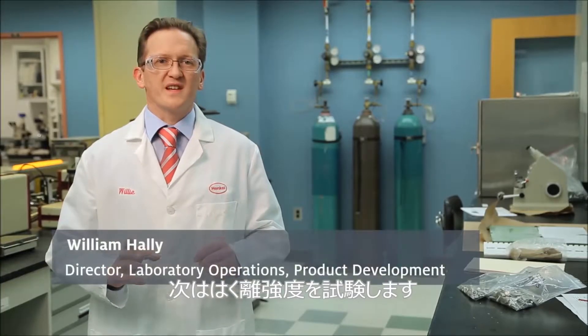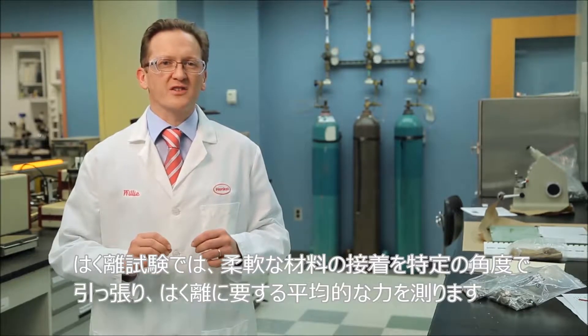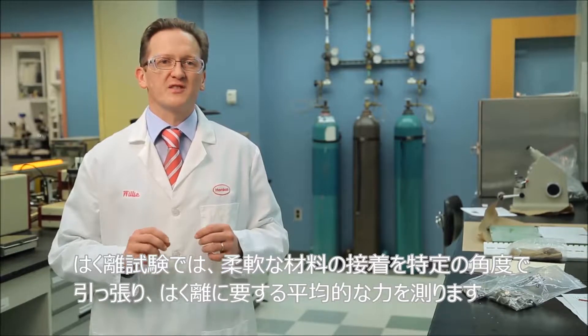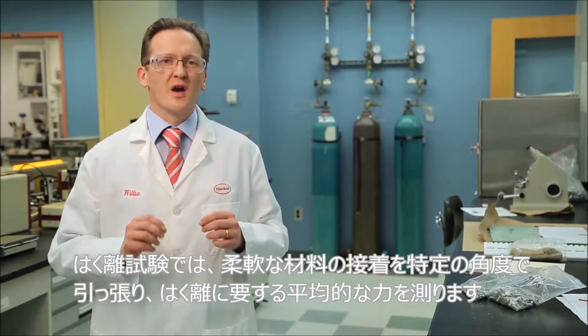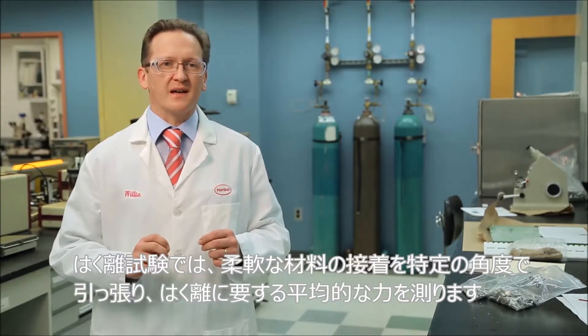Next we are going to test peel strength. Peel tests measure the average force required to fracture the adhesive bond between flexible materials when pulled at a specified angle.